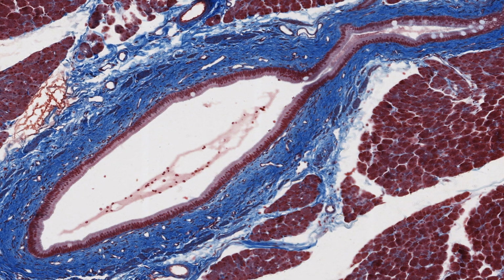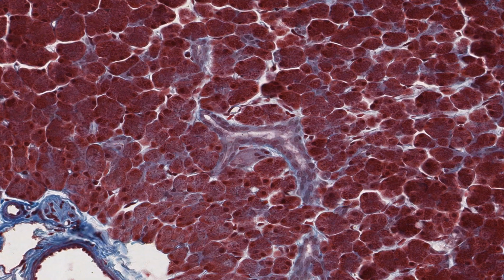Note this large interlobular duct lined with simple columnar epithelium and stratified areas as well, probably stratified cuboidal, as the cell nuclei are towards the lumen around it. This duct is heavily invested with collagenous connective tissue. Small blood vessels are also present. And you can see here what I mean when I told you the secretory acini were overstained.